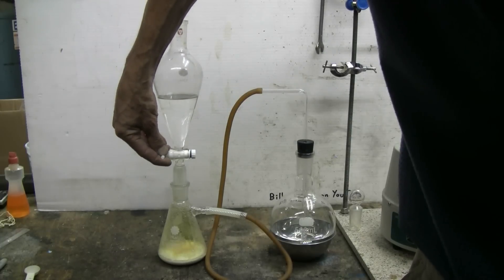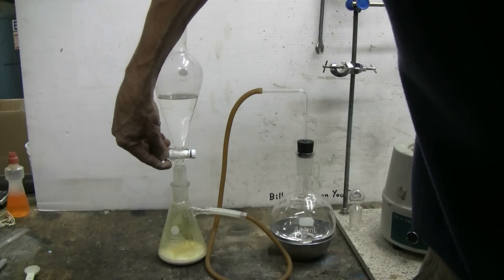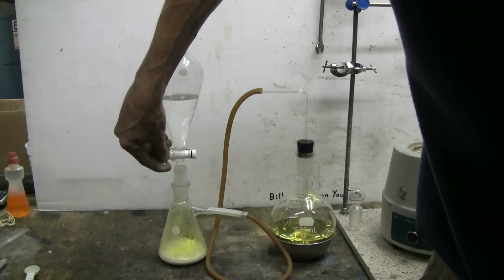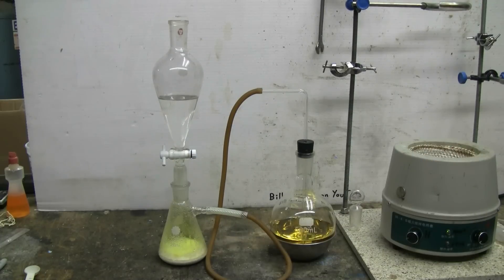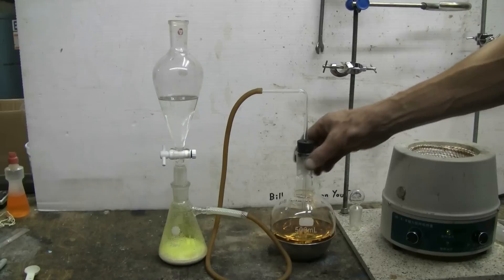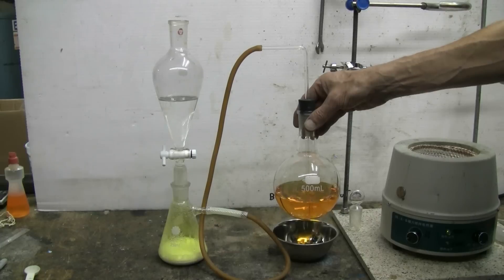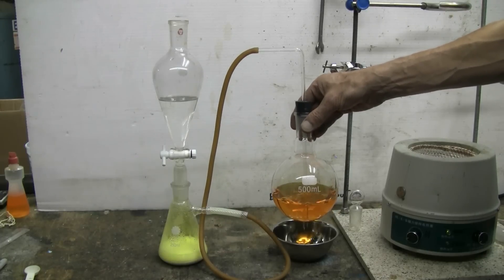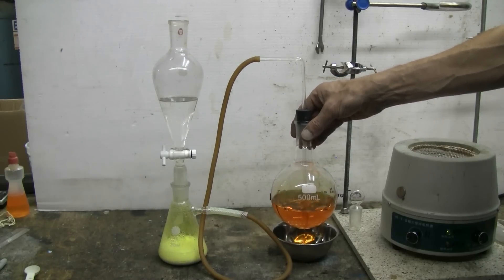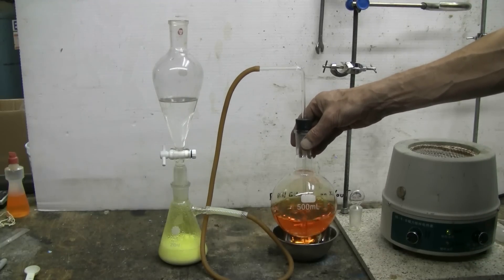I'm now going to allow hydrochloric acid to start dripping into the flask - we want just a bit dripping in at a time. Now chlorine is generated. We can see the green or greenish-yellow gas forming in there, and there's an immediate color change in the sodium bromide as the chlorine gas begins to bubble through, displacing the bromine from the sodium bromide. We'll wind up with free bromine in this flask and of course some sodium chloride.